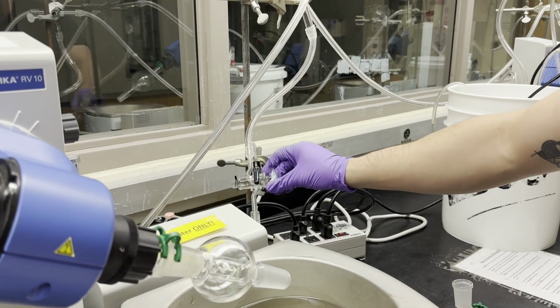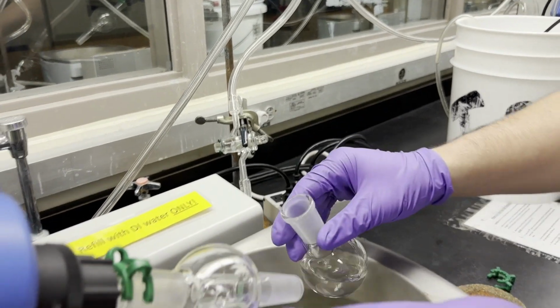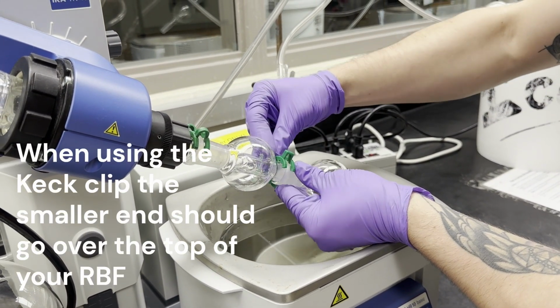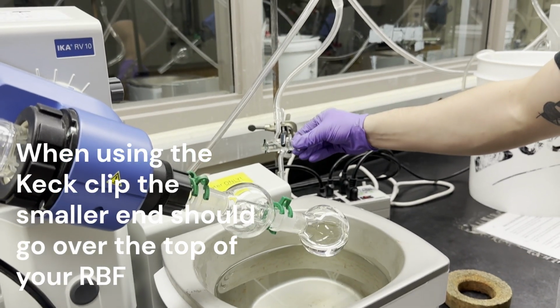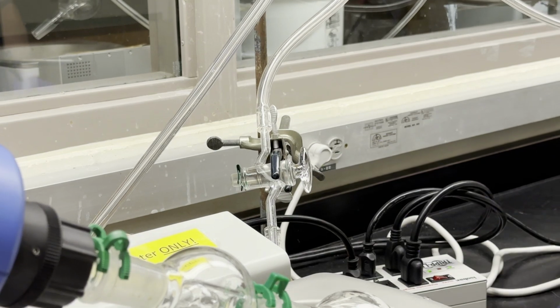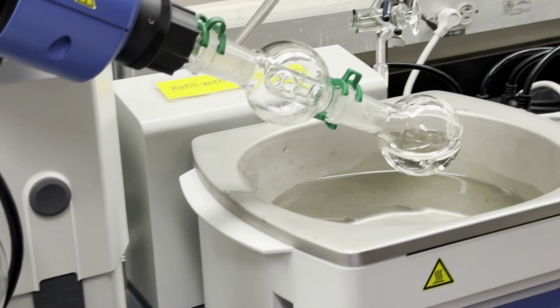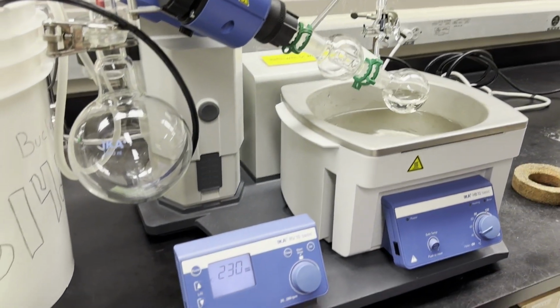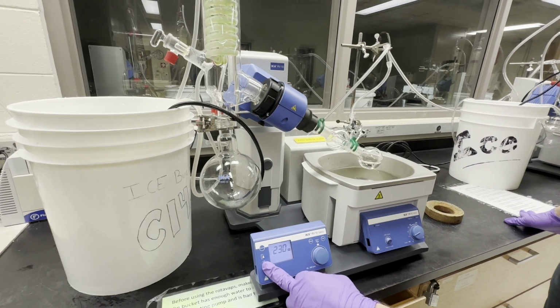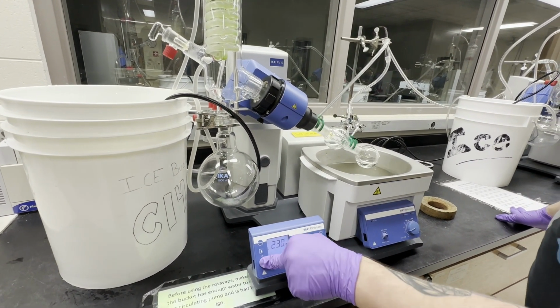Okay, all right, so we're going to make sure that we are disconnected from the vacuum. We're going to put our round bottom flask on with a clip, and we're going to reconnect the vacuum slowly, and you'll begin to see evaporation very soon. And we're going to use this machine right here to spin the round bottom flask, increasing the surface area, thus making the process work a lot more quickly.